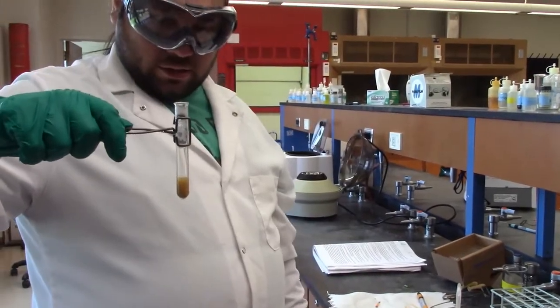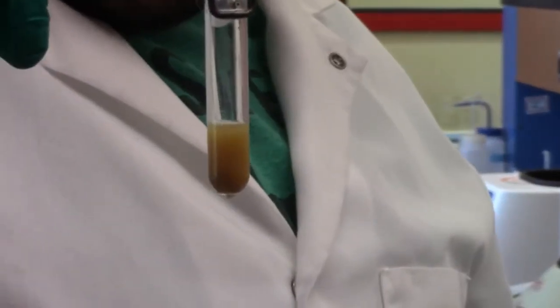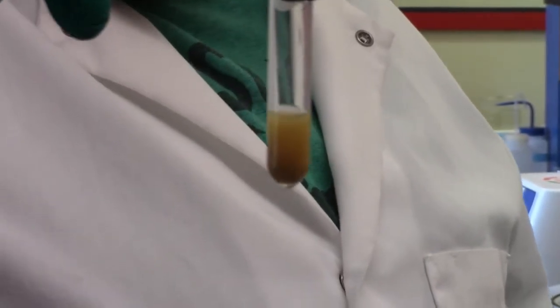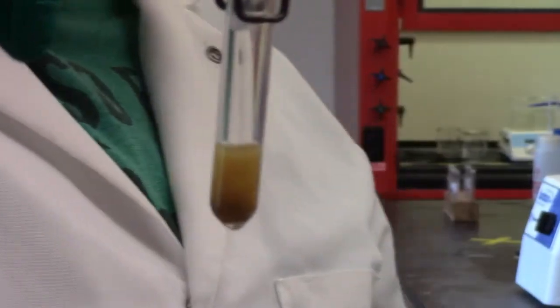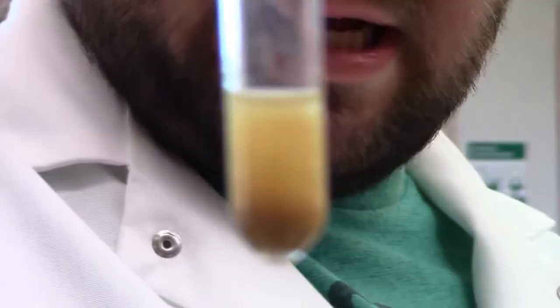So if you guys look closely at this, you can now see that we've got a precipitate that's pretty much just this solid chunk of stuff on the bottom. We haven't centrifuged it, so it's not like a full pellet. The solution itself is still kind of cloudy, but there is a clear precipitate, and I'll bring it a little closer just in case it's not showing up. And there you have it. We have confirmed the presence of tin.